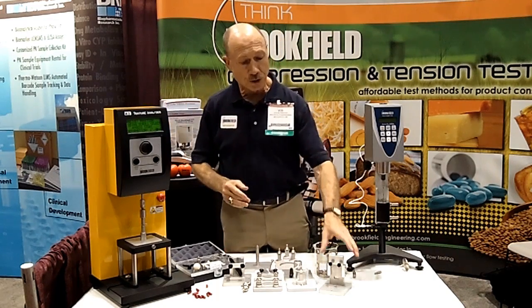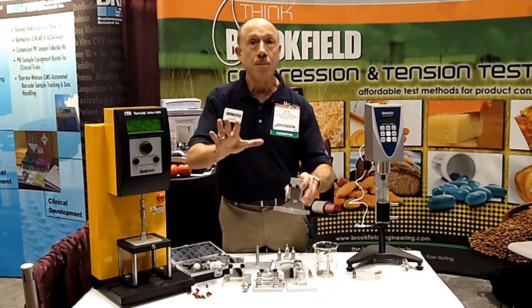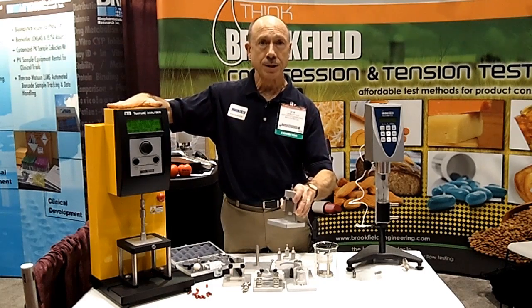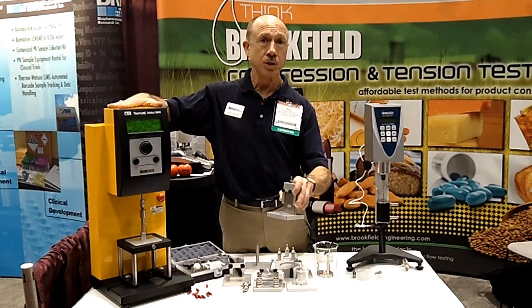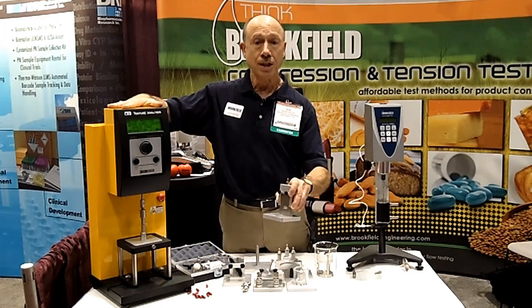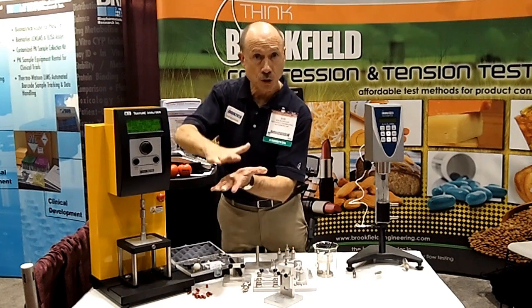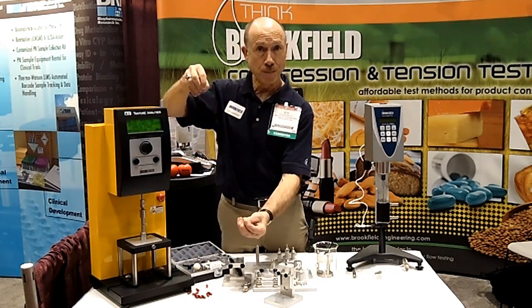Let me show you one item here. The CT3 Tester is a machine that does compression and tension testing, so it can come down and either squash something or pull it apart.